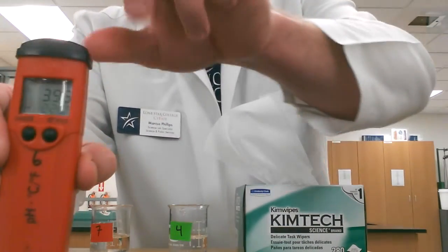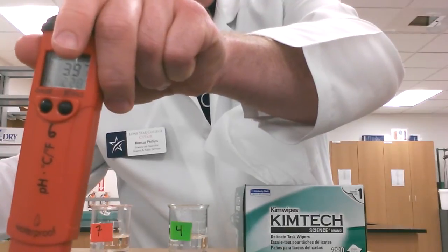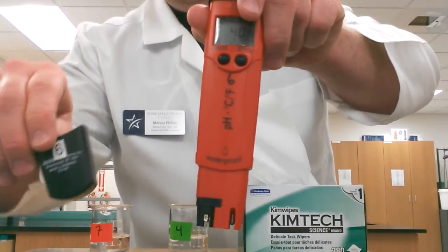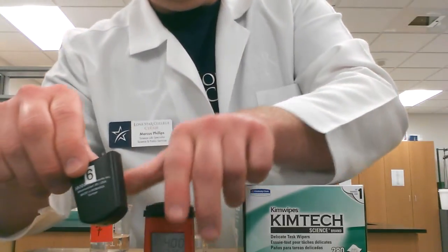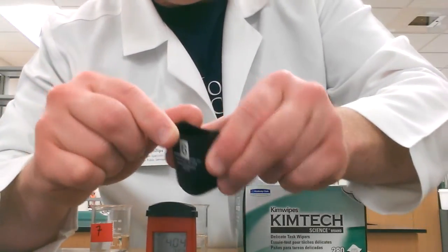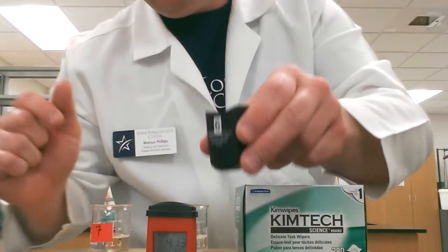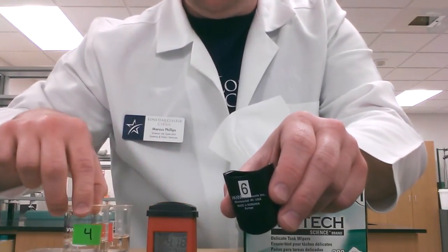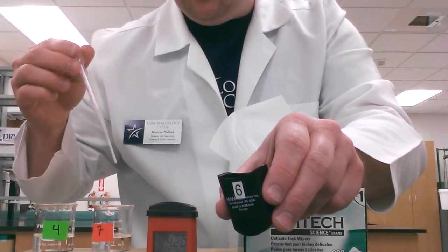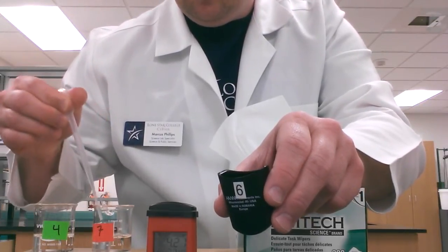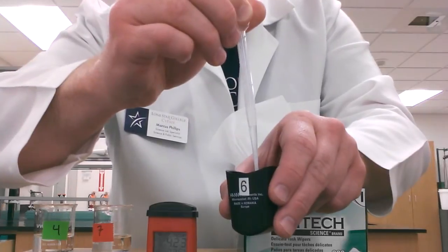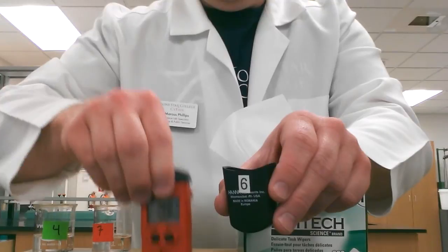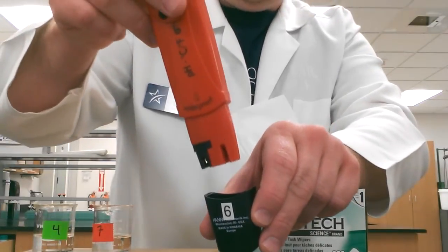Or in my case, I'm going to store it again, so I'm going to put the cap back on. Before I put the cap back on, I'm going to make sure there's pH solution inside that little cylinder inside the cap. And I need a little bit, so I'm going to take some pH 7 solution from my pH 7 beaker, I'm going to pipette it out and pipette it into the cylinder.